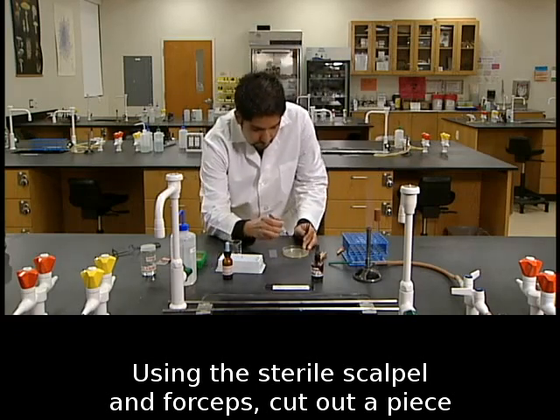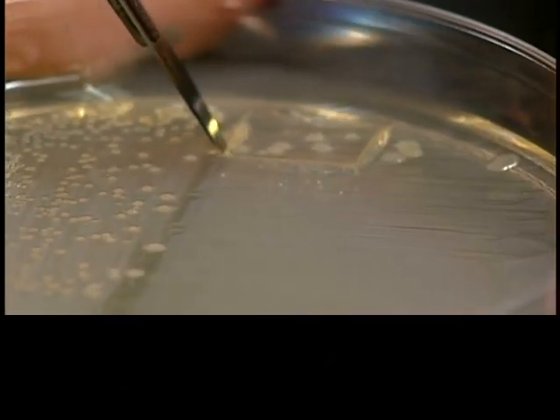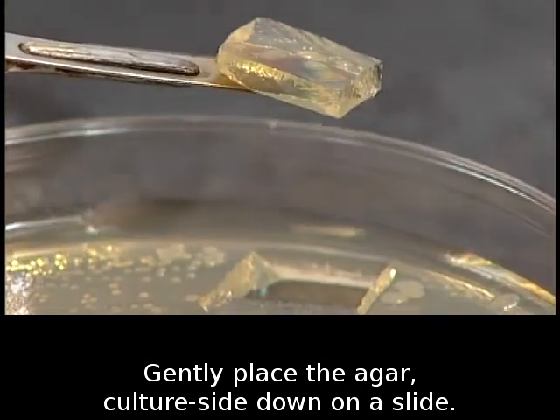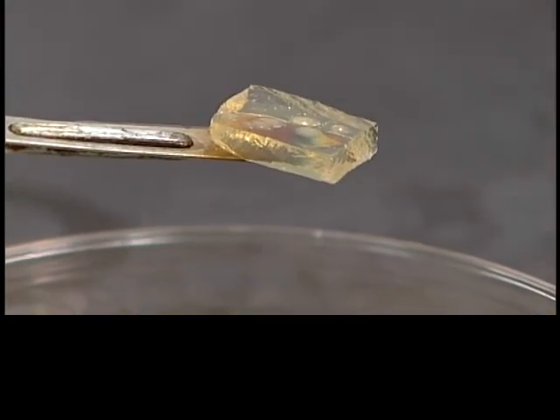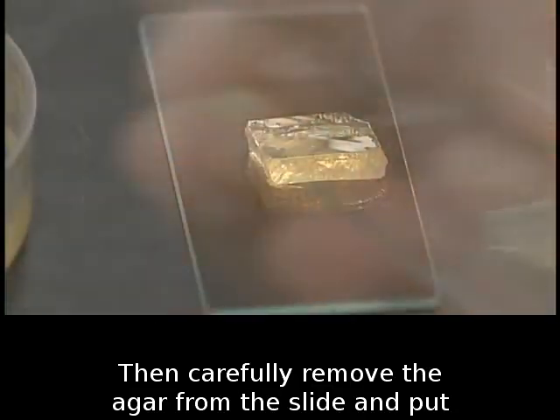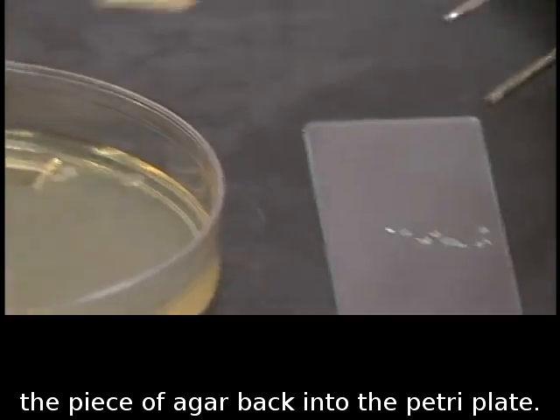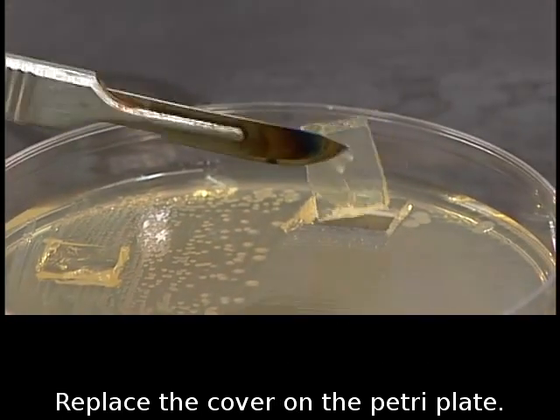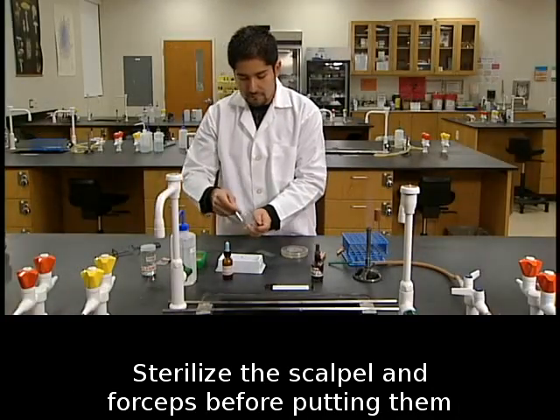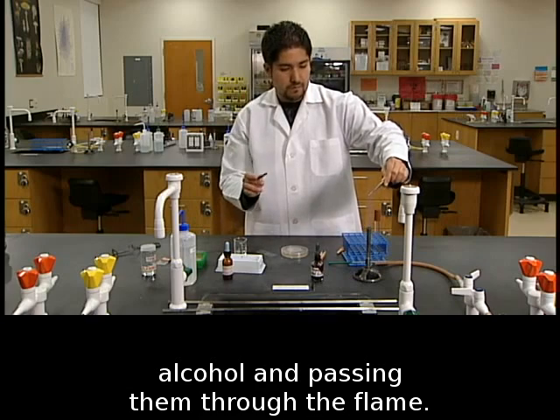Using the sterile scalpel and forceps, cut out a piece of agar on which your test bacterium is growing. Gently place the agar, culture side down, on a slide. Then, carefully remove the agar from the slide and put the piece of agar back into the Petri plate. Replace the cover on the Petri plate. Sterilize the scalpel and forceps before putting them down. Sterilize the instruments by dipping them in alcohol and passing them through the flame.